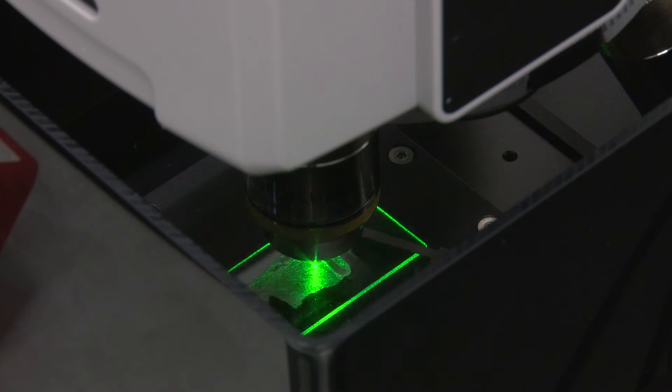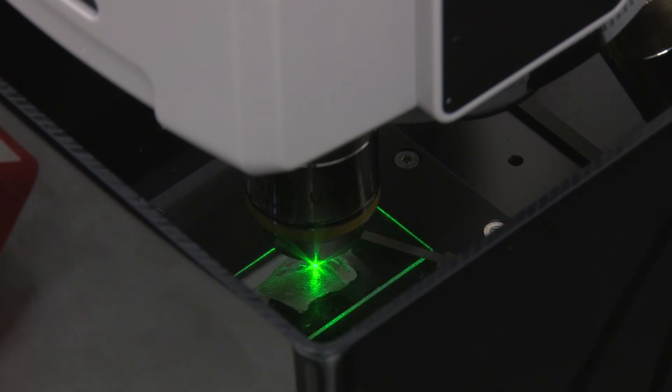So what we're working on at the moment is we're looking at underneath here. If you look in there's a little slice of meat.